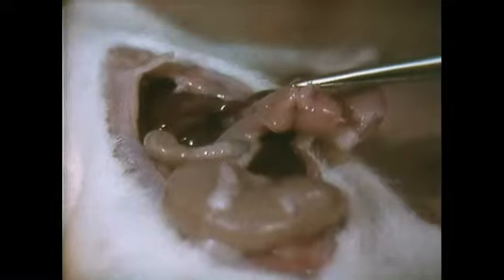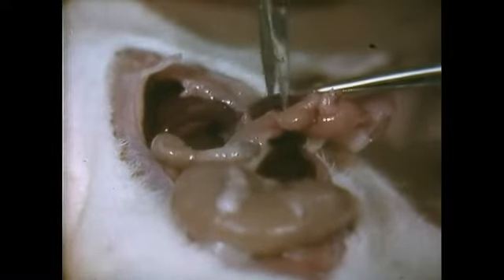However, electrons have a much shorter wavelength, and if we use electrons as the illuminating source in an electron microscope, we can obtain much higher resolution and therefore much greater magnifications. This glass slide is not, however, much use in an electron microscope, so I'll have to start with a fresh piece of pancreas.